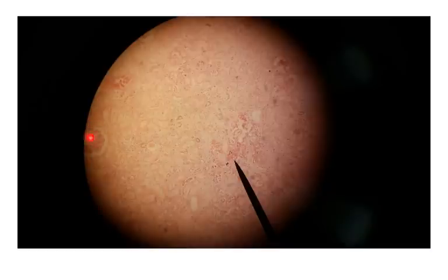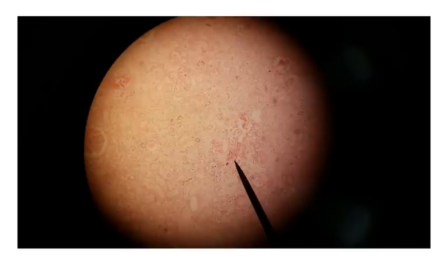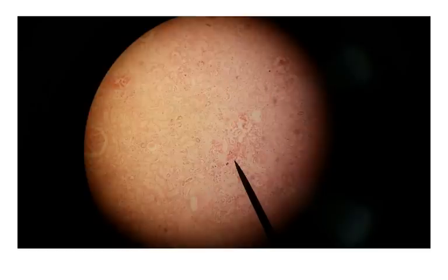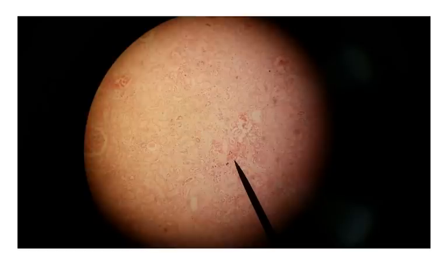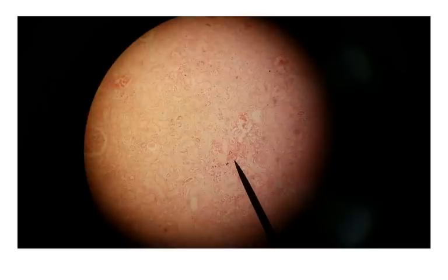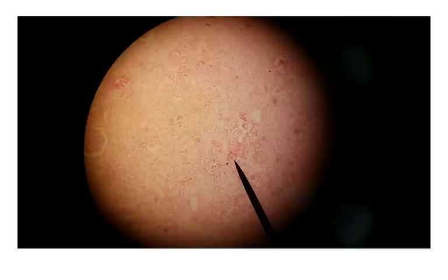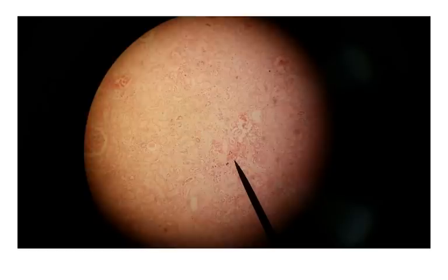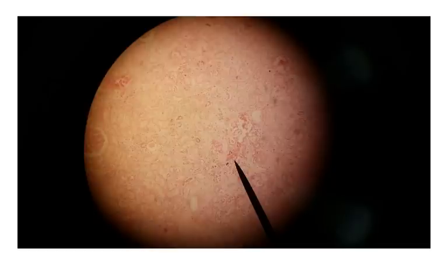This slide — except for one renal corpuscle on the edge — is almost entirely made of kidney tubules. If you see kidney tubules but no renal corpuscles, that tells us we are in a deeper part of the kidney — the renal medulla — compared to the previous slide, which was the renal cortex. The renal cortex contains both renal corpuscles and kidney tubules; the renal medulla only contains renal tubules.